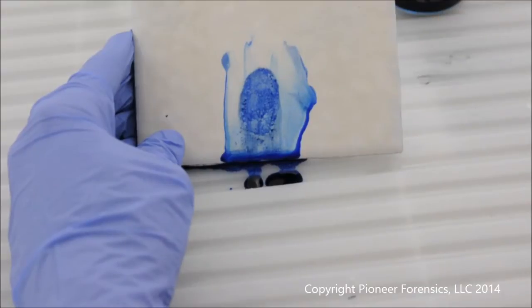In this case, you have a bloody fingerprint. So you can see the cascading effect of the rinse is taking away all the excess stain, leaving just the bloody fingerprint behind. It has exceptional contrast ability, which is one of the reasons it's a favorite stain.